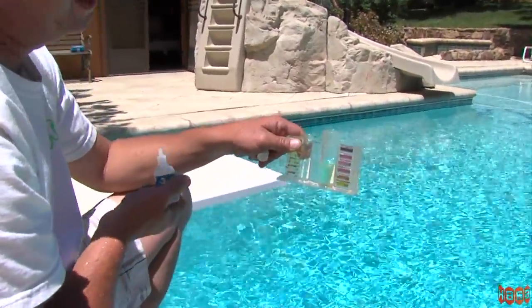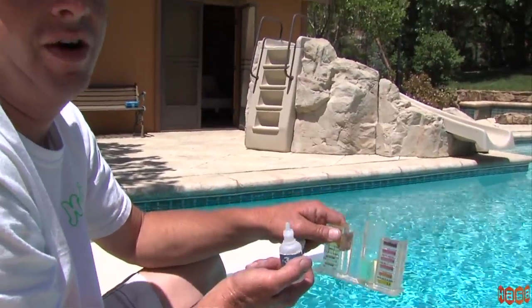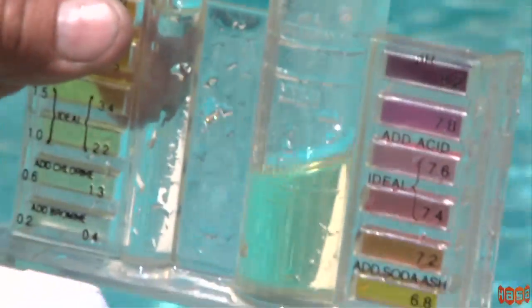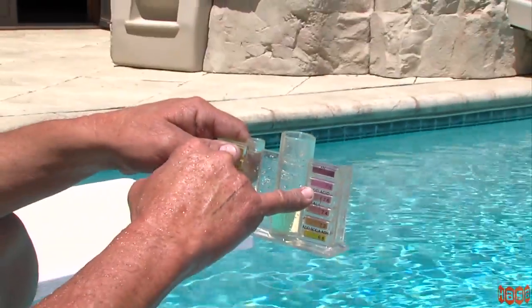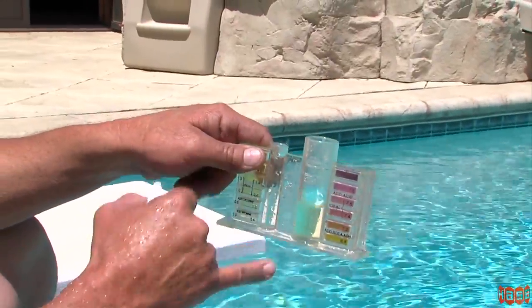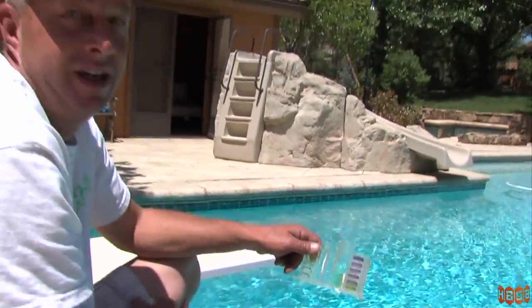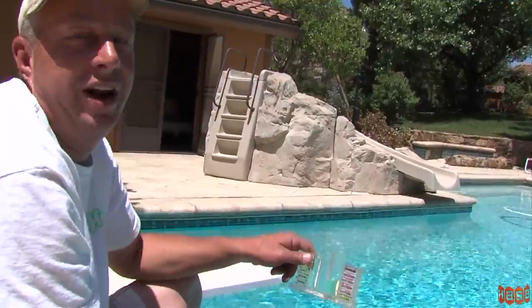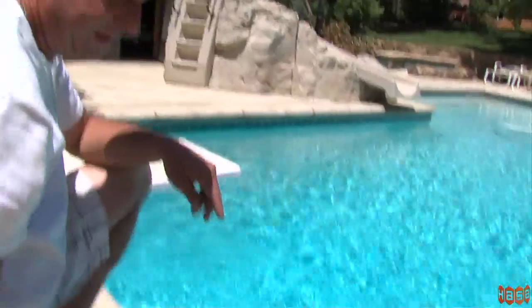Okay, so that's eight drops, and it changes to yellow here. So the alkalinity in the pool is actually really low. The pH is at 7.7 — even though the pH is high, your alkalinity is more important than your pH. So you don't want to drop the alkalinity too awfully low.